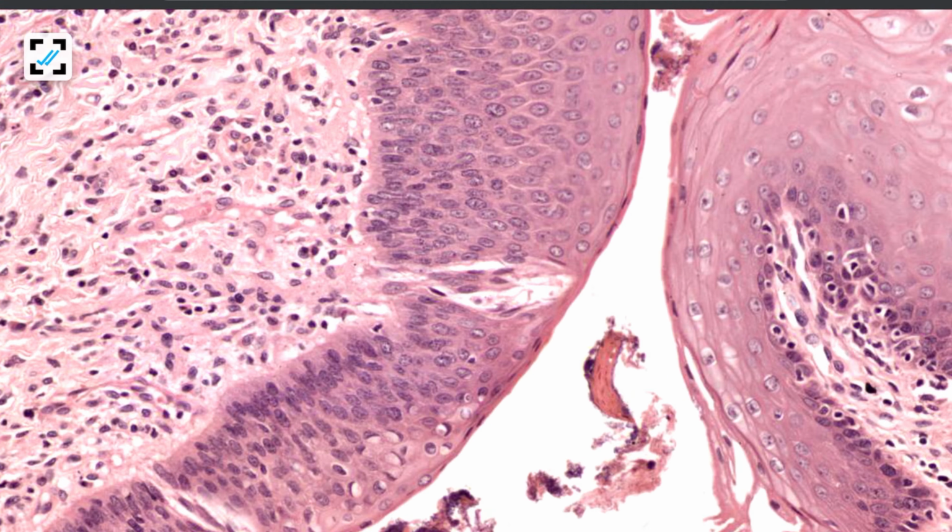Even though taste buds are widely distributed in the dorsal surface of the tongue and surrounding structure, they are most numerous in the circumvallate papilla. Each circumvallate papilla on an average has about 250 taste buds. Each taste bud appear as a pale staining barrel-shaped body that extends throughout the thickness of the epithelium. Close to the epithelium, they have a small opening which is referred to as the taste pore or the gustatory pore. Each taste bud is made up of 3 types of cells: neuroepithelial, basal and supporting cells.